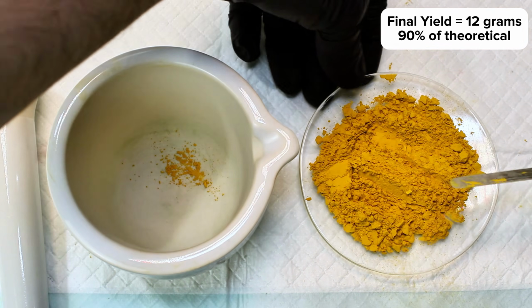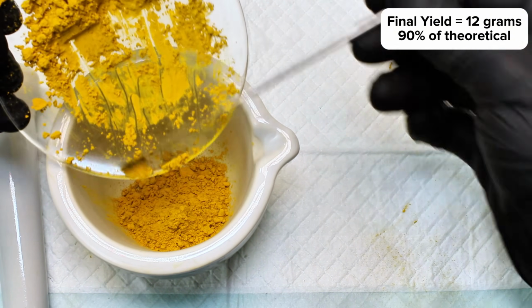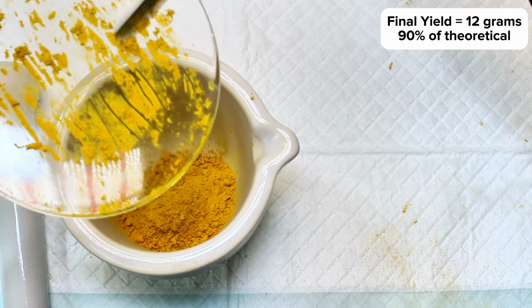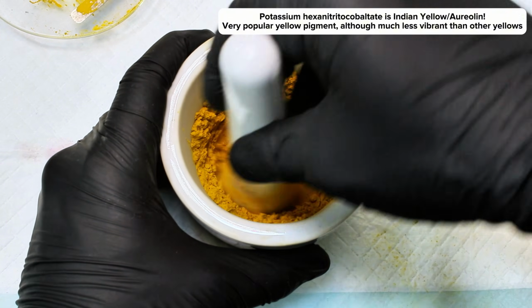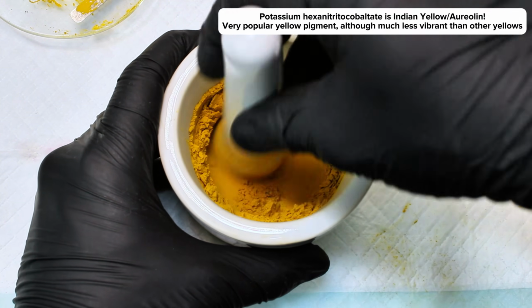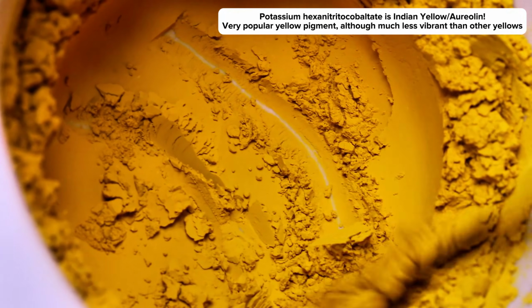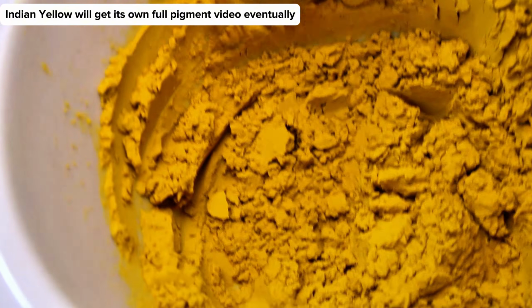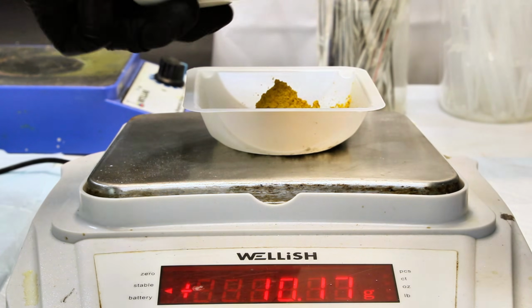Now, what's interesting about this third complex, aside from it being the only negative one of the bunch, is that potassium hexanitrocobaltate is sold as a popular yellow pigment more commonly called Indian yellow. Given that I filmed this third reaction ages ago and could significantly streamline the procedure from how I showed it here, this complex will eventually get its own full pigment video. In the meantime, however, I figured it was silly to leave it out of a video on trivalent cobalt complexes. In any case, that's all I have for today.